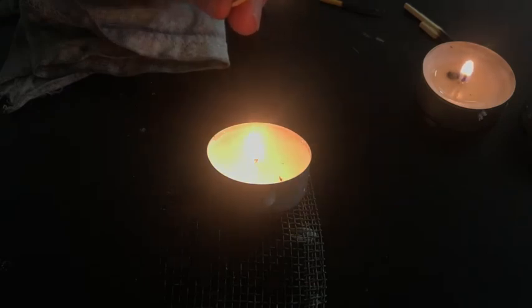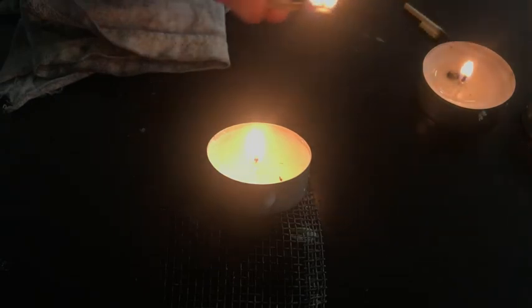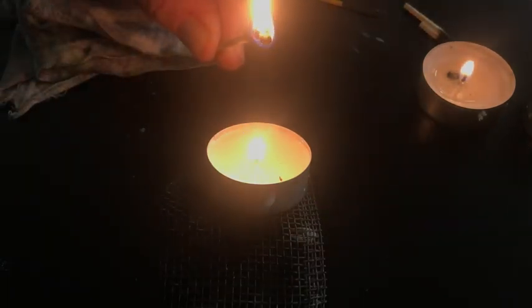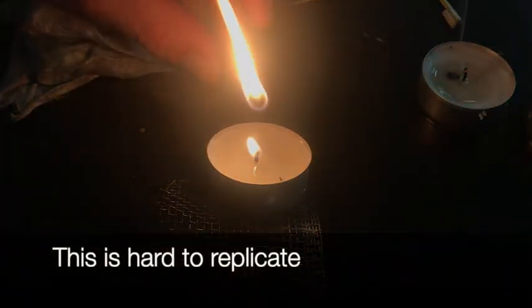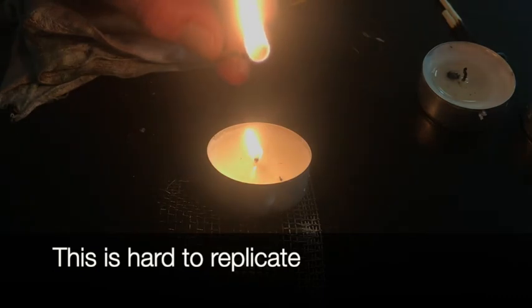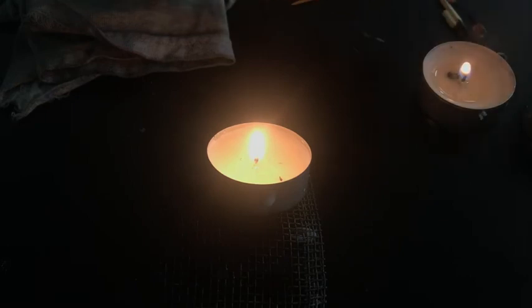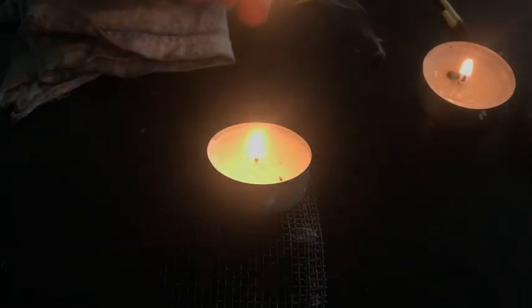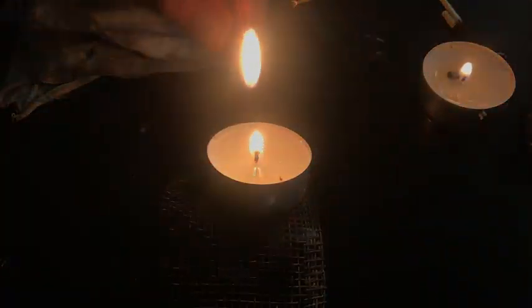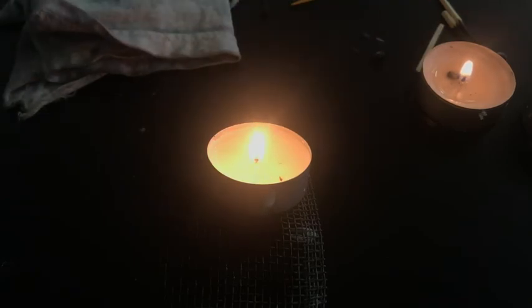So, good thing it was on video. We need to have a flame again. So I'm going to come over here and see. One more time. Let's see if this gets my... yay.